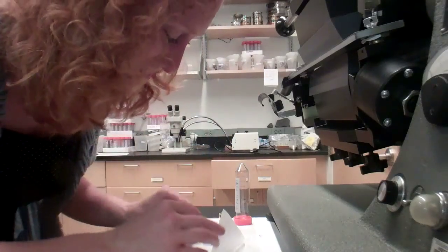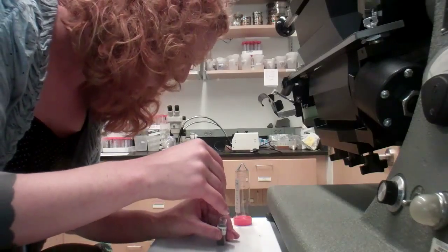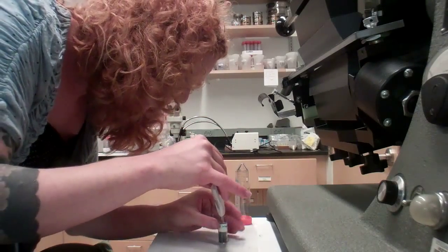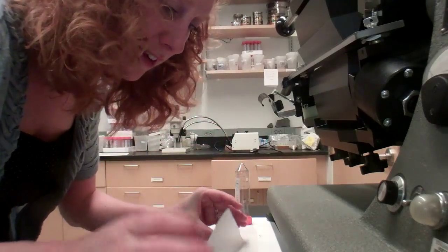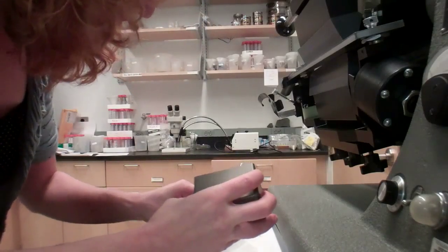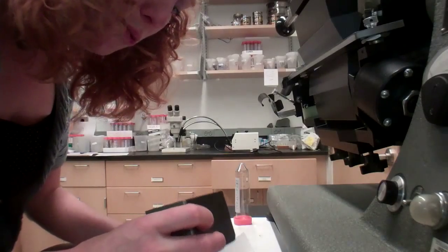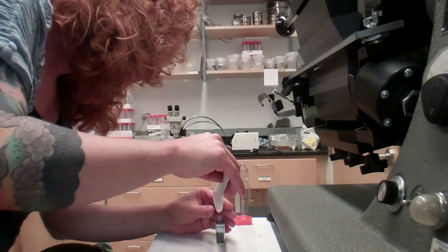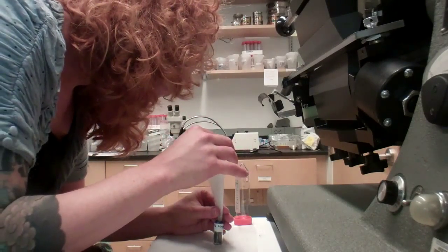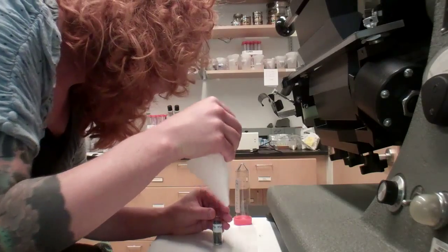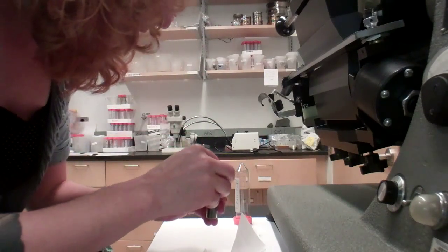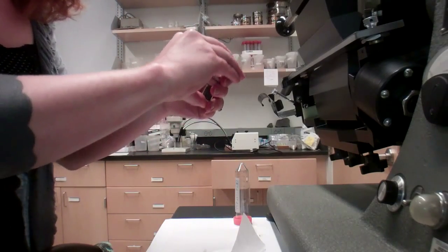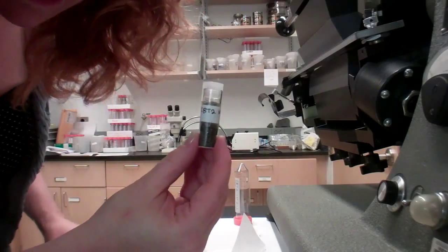So right now I am bottling up the magnetic portion of our sample CB2 and I'm putting it in this little vial that's labeled. Here we go. I'm tapping up the little bits that are left. There's still some in here. Oh, there we go. Alright. This we're going to store and put away because we don't need it anymore, but it's labeled just in case we want to look at it later.